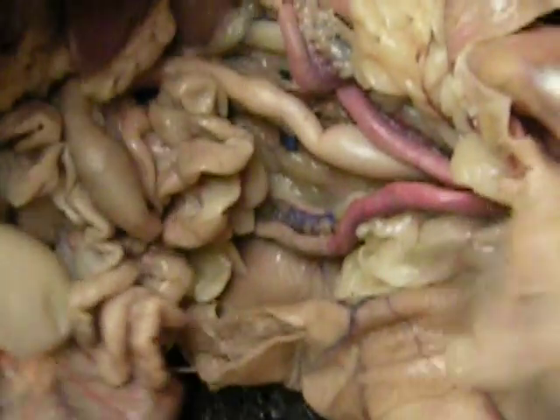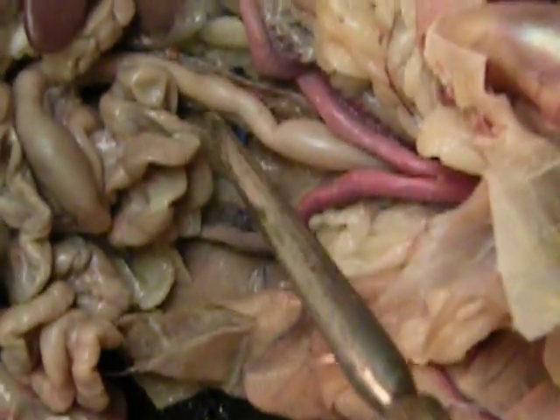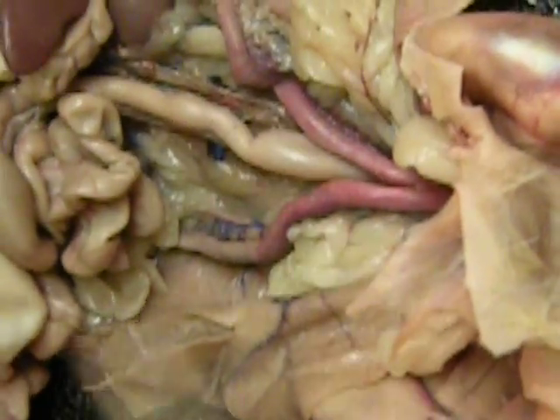On top of it, you have the infundibulum. Don't get the uterine horns confused with the colon or rectum right here.